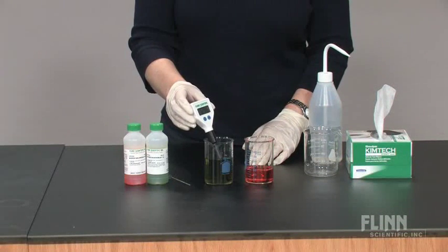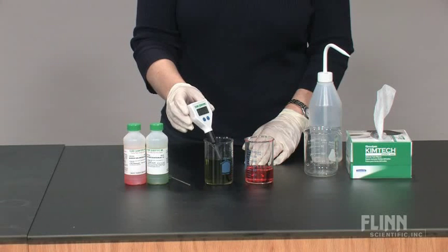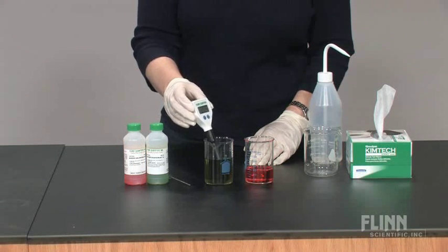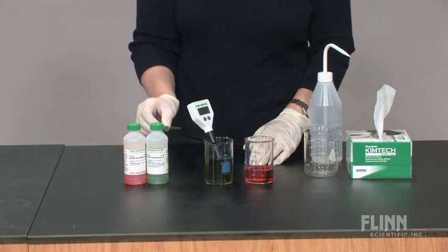pH calibration. Prior to use, remove the protective cap and condition the electrode by soaking the tip in pH 7 standard buffer solution. Stir gently and wait until the display stabilizes.